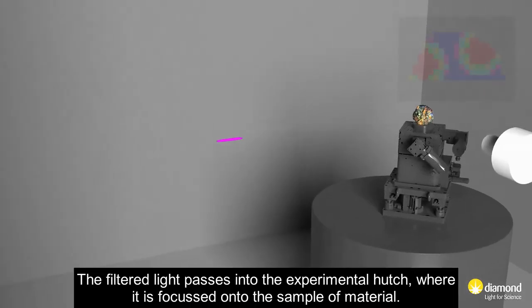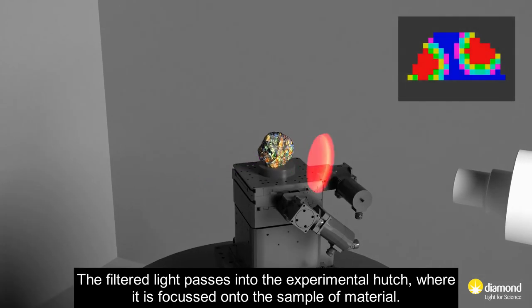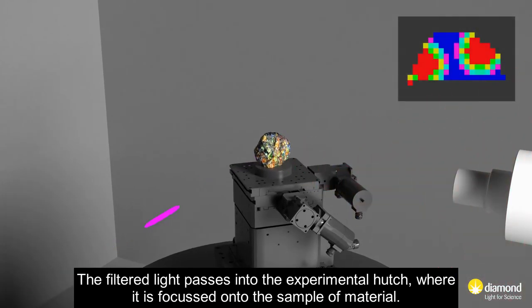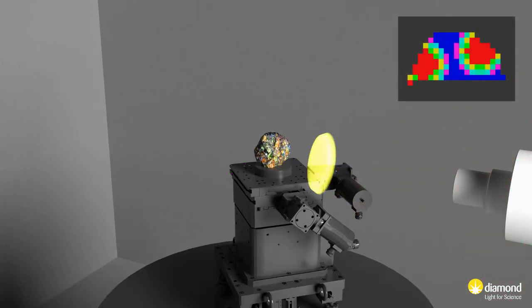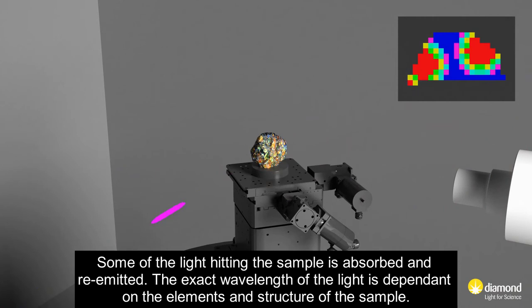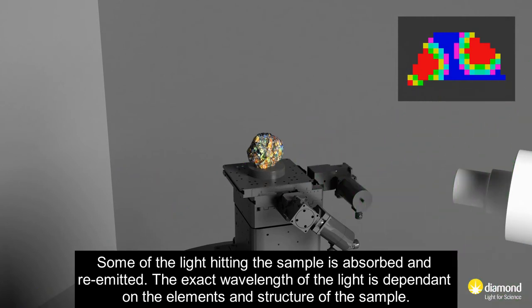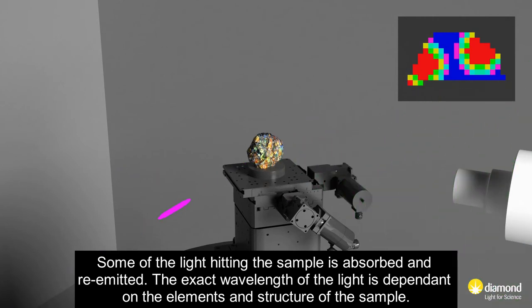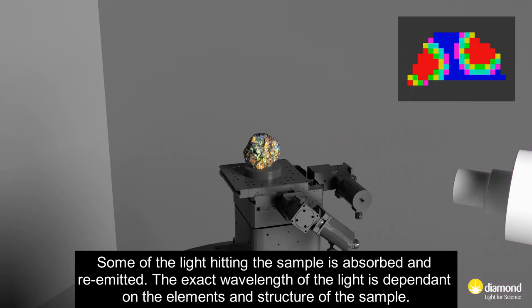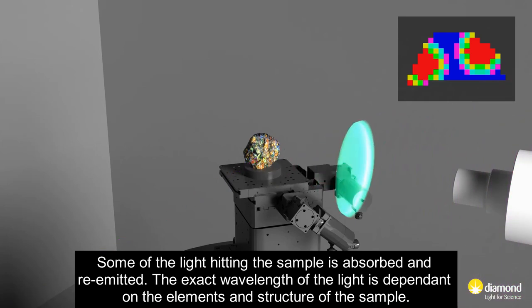The filtered light passes into the experimental hutch, where it is focused onto the sample of material. Some of the light hitting the sample is absorbed and re-emitted. The exact wavelength of the light is dependent on the elements and structure of the sample.